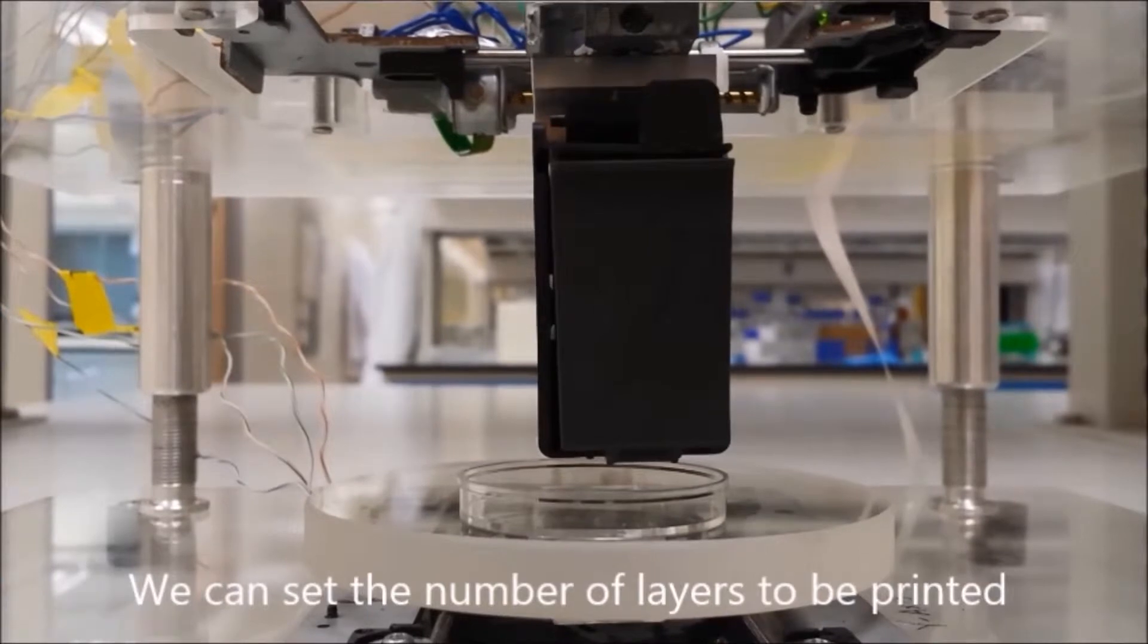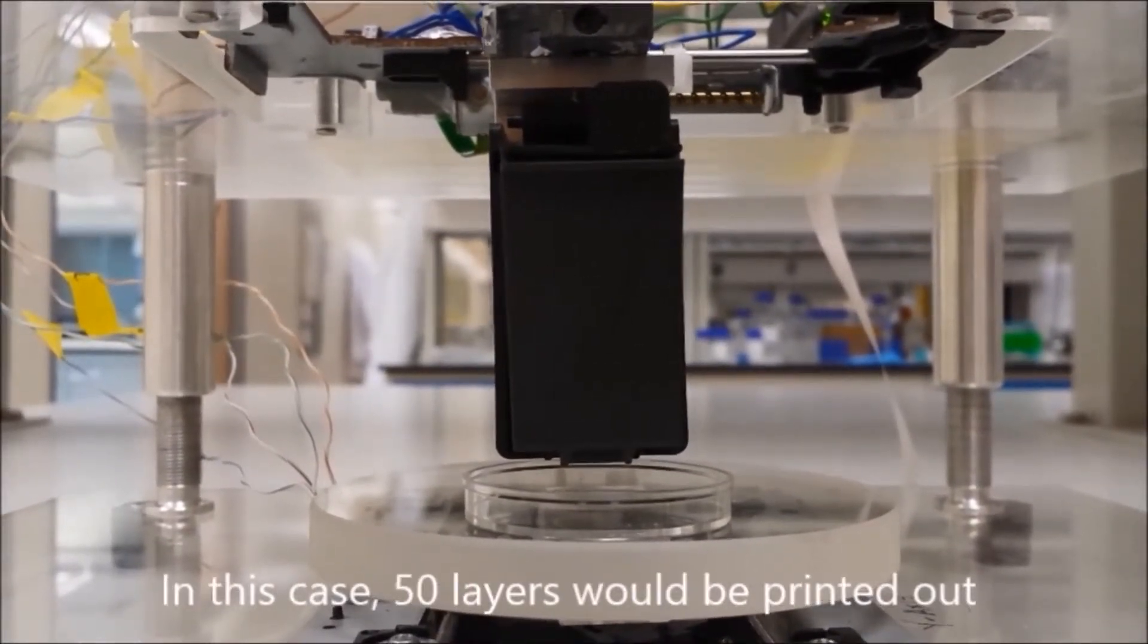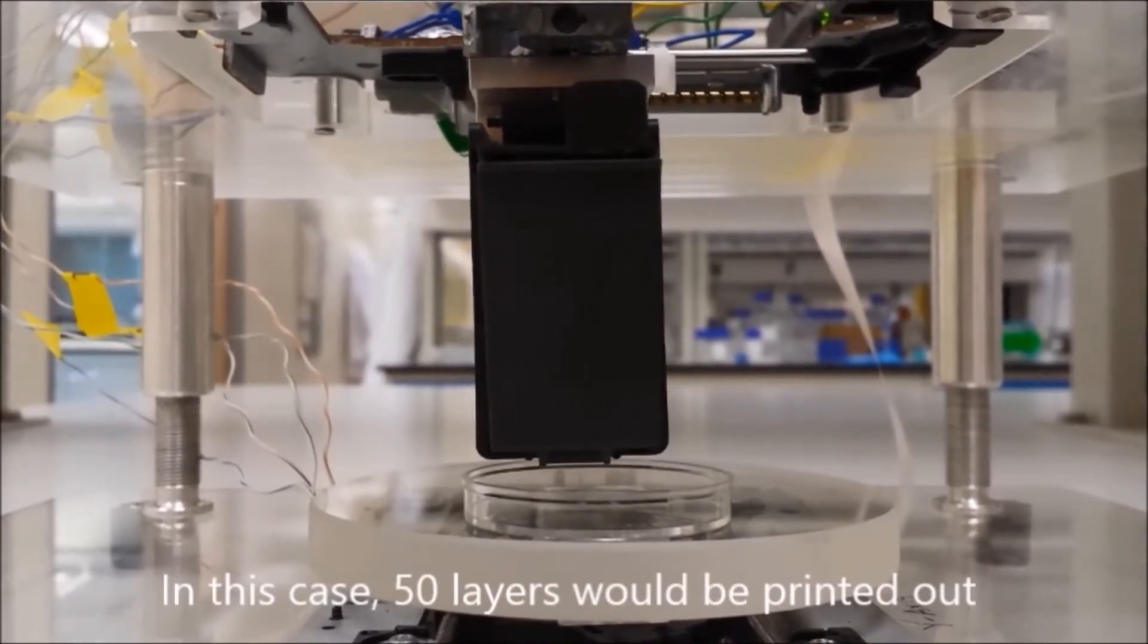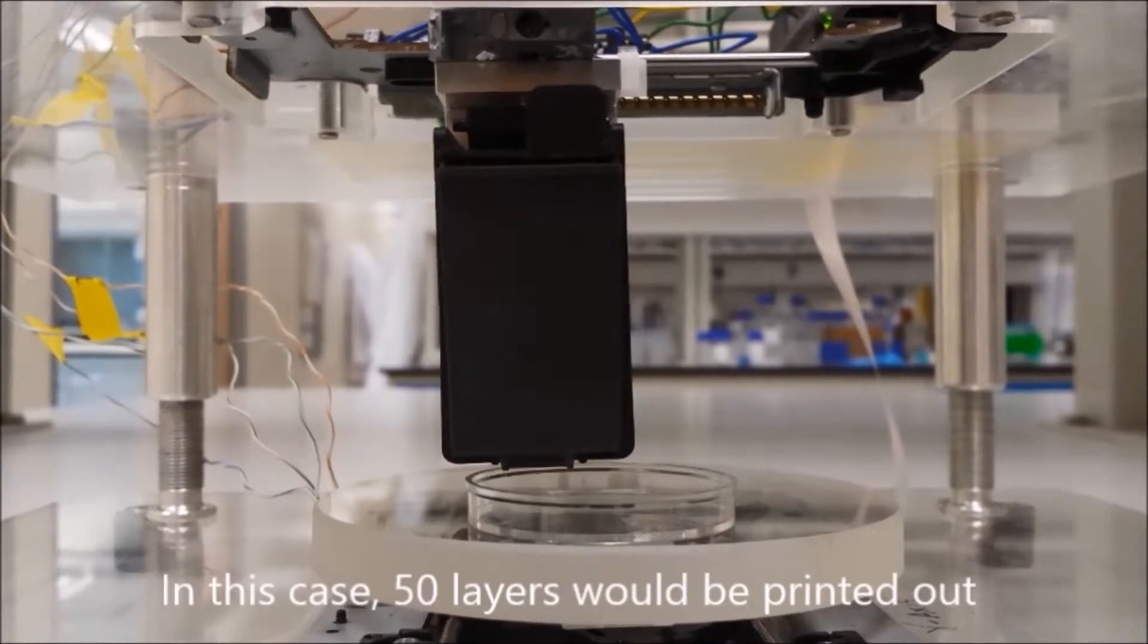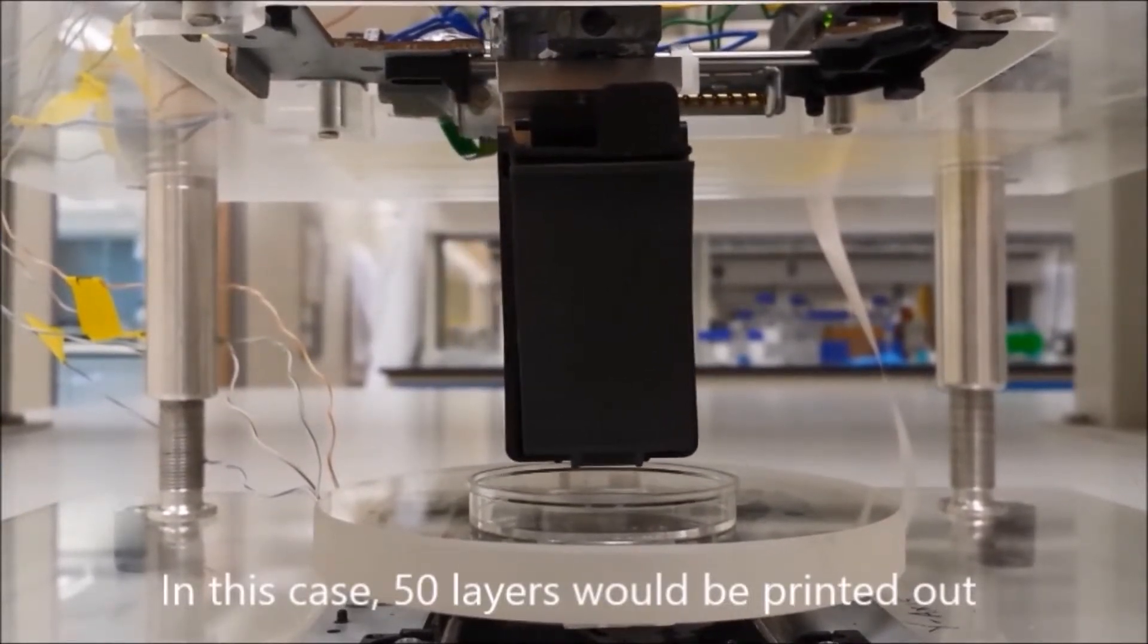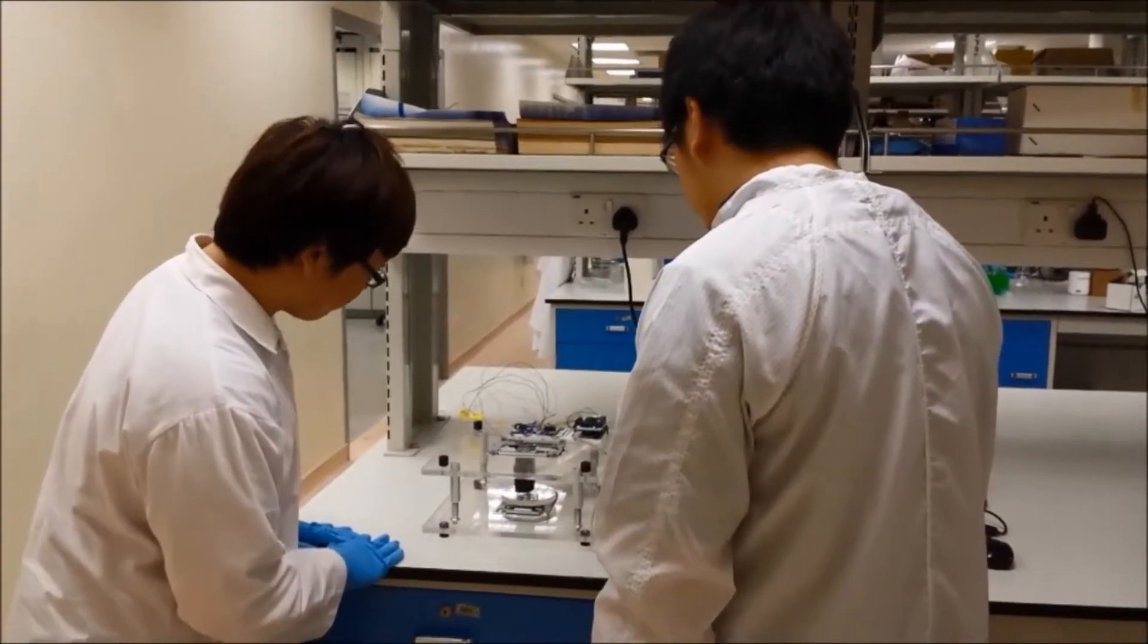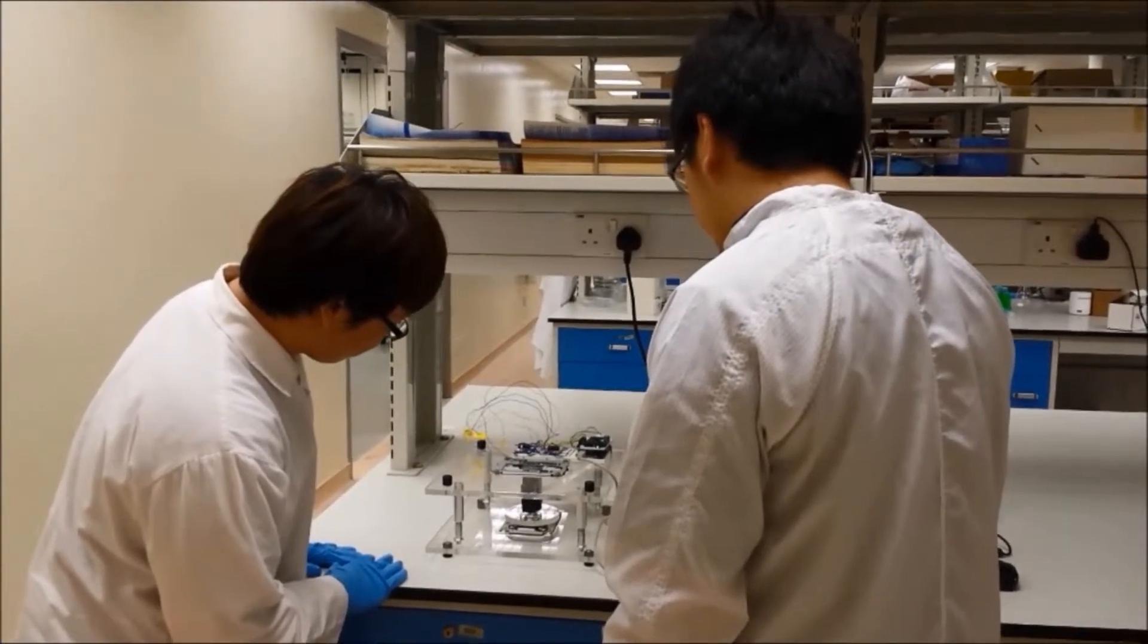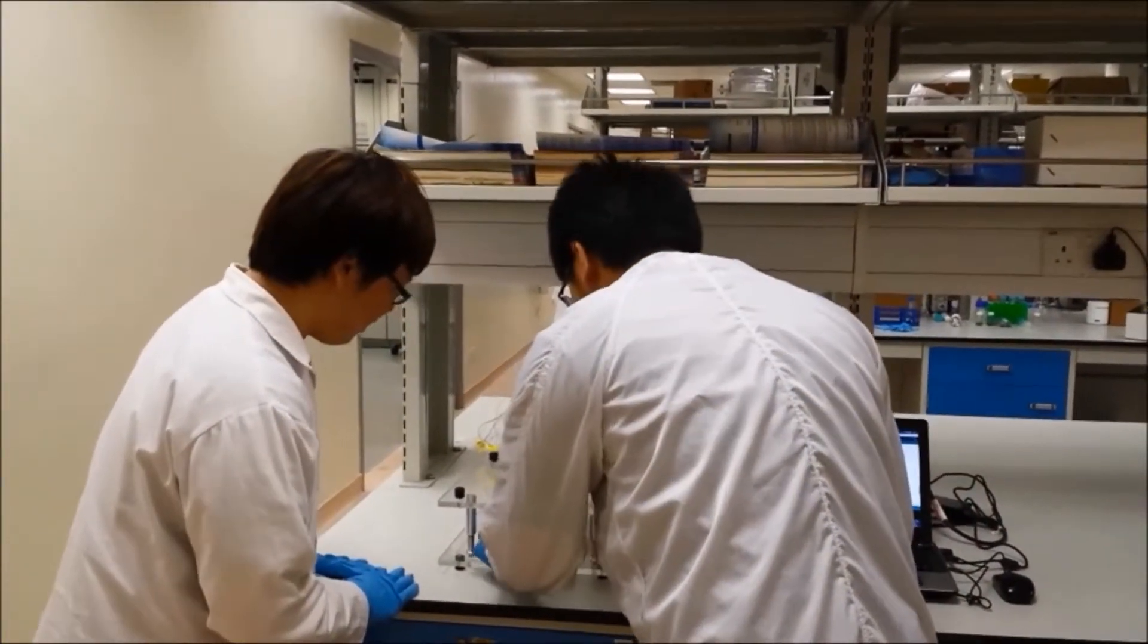Let's start the bioprinter in position. Okay. Alright.